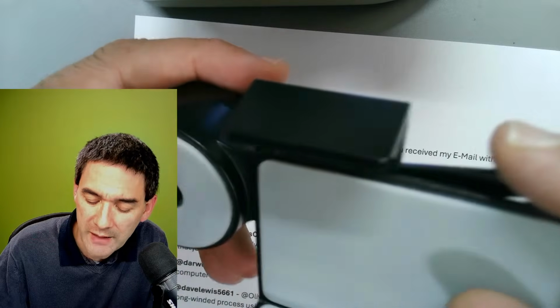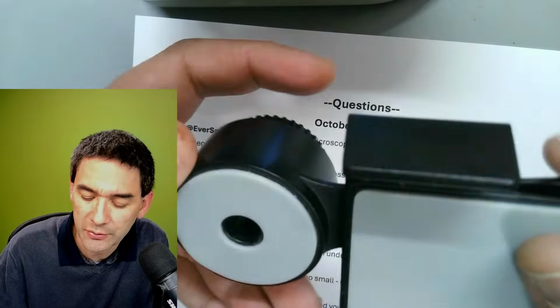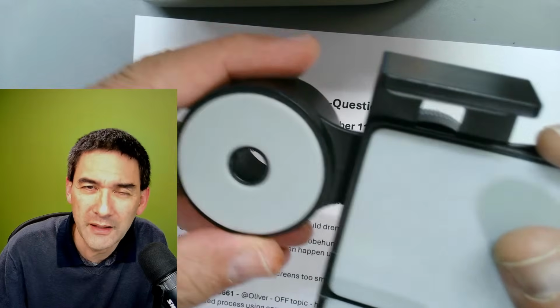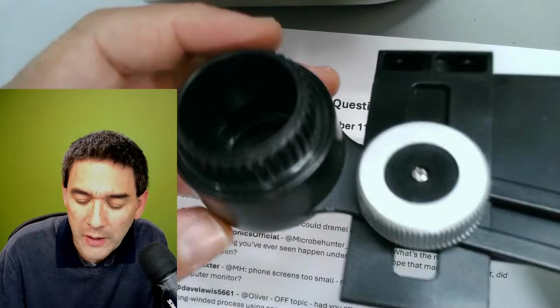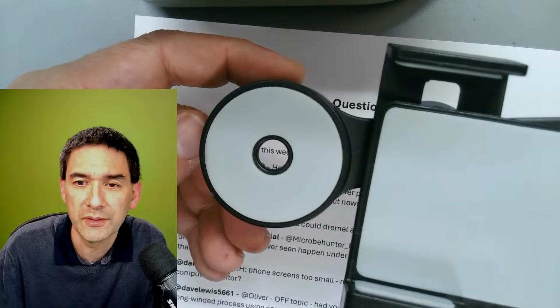The other question that I have is that with those adapters, I'm able to adjust and center it. If I 3D print something and it's a little bit off, and it's made of one part, then I might not be able to adjust it quite as easily. But I've not tried it yet. Certainly a possibility to try it out.